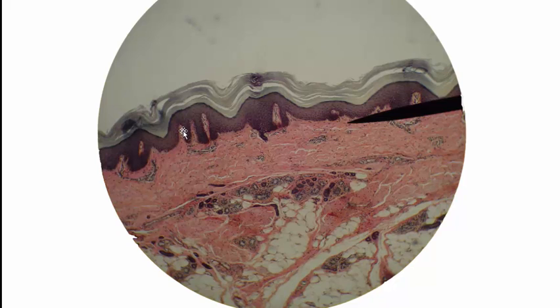One of them is the dermal papillae projecting up to the epidermis has an effect on the structure of the epidermis. And in thick skin, that creates what we call friction ridges, also known as fingerprints. You can see that the surface of the outside of the epidermis here has these kind of waves to it. Those are actually fingerprints under high magnification. And that's created by these dermal papillae underneath that then affect how the epidermis grows and causes it to have those peaks and valleys that we see.